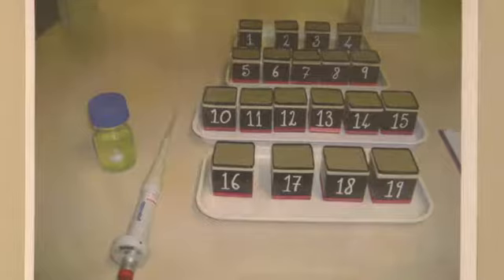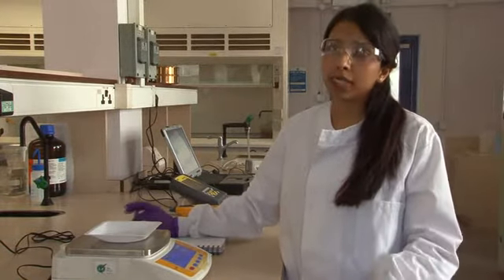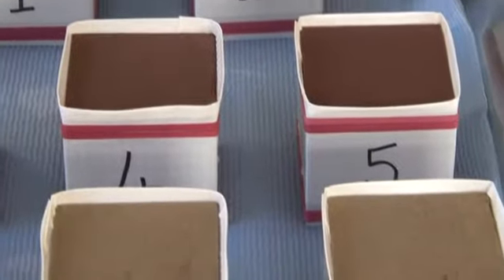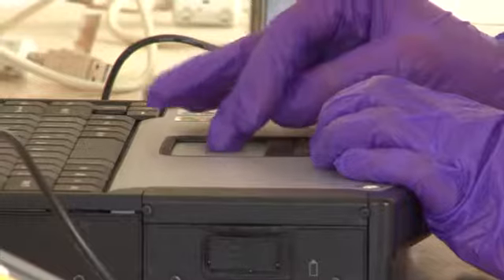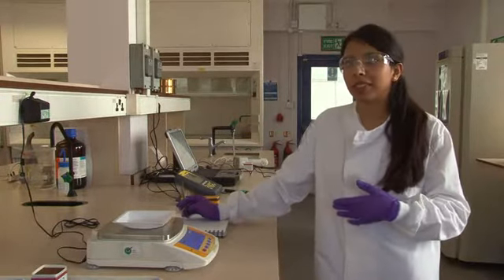The aim of this experiment is to see the impact of a test species of algae, that's Stichococcus, which is commonly found on building stones in the UK, on two test sandstones, that's St Bees and Dungannon, which are found especially in the northern parts of the UK. So how they respond to algal growth, and if the growth of the algae causes deterioration to the stone on which it grows. We'll be measuring the growth of the algae over 1 month in conditions of maximum yield, by which I mean climatic conditions which are favourable to algal growth.